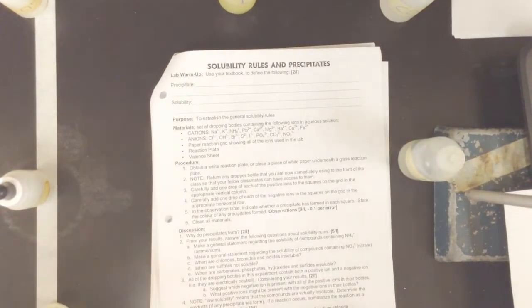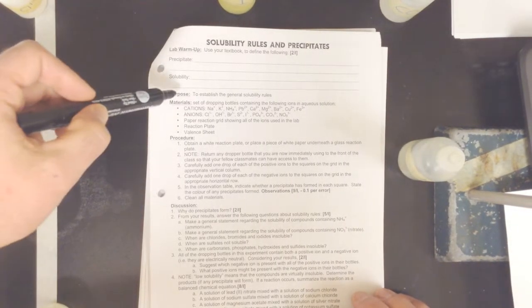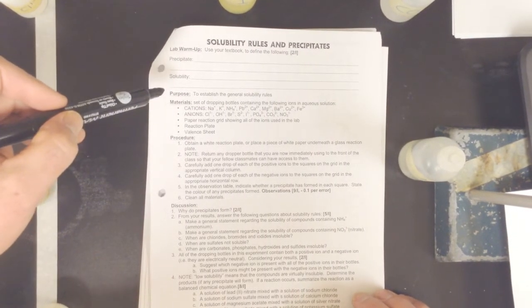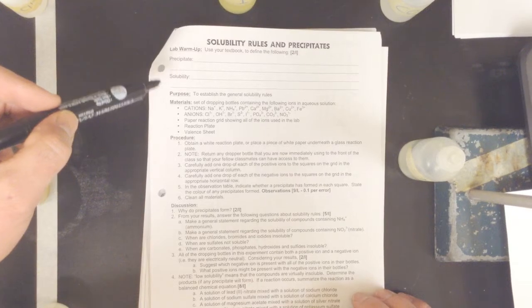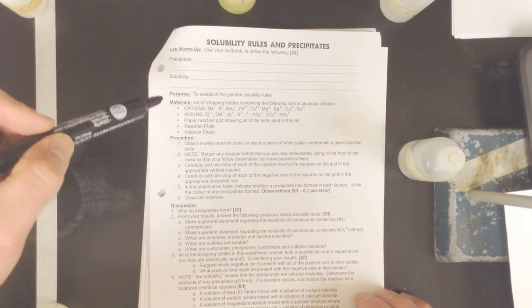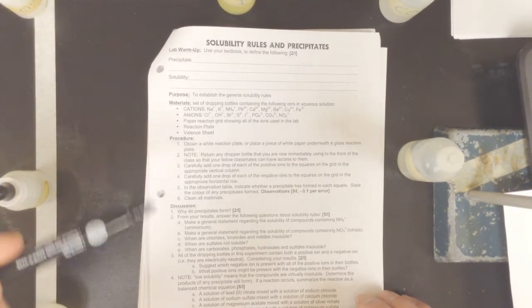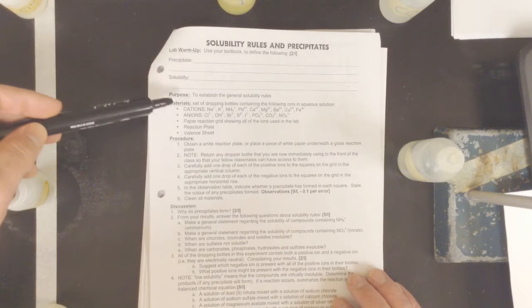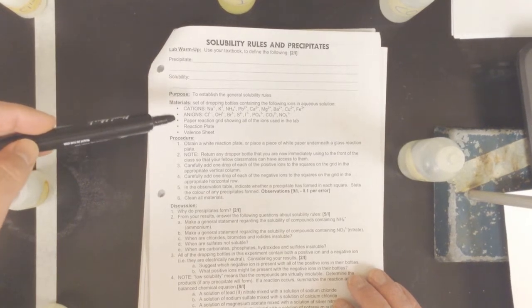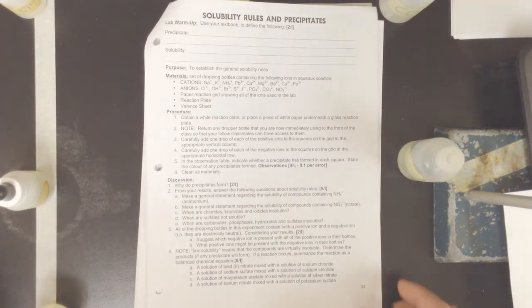Here is our worksheet that we'll be working with today. So we are working through solubility rules and precipitates. I'm going to give you a little bit of time. Make sure you pause the video and look up these definitions, either using the textbook section that was posted or just a blanket internet search. So what is a precipitate and what is solubility? We've kind of gone over what solubility is a little bit with dissolving. Now, we've got a whole bunch of materials here. We've got a whole bunch of cations, and I'm going to be working through this, and you have some discussion questions to answer at the end.